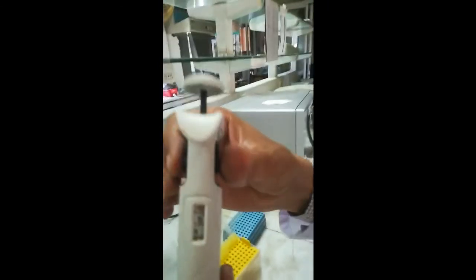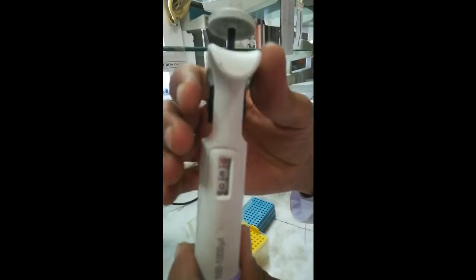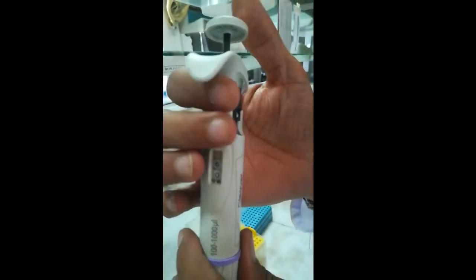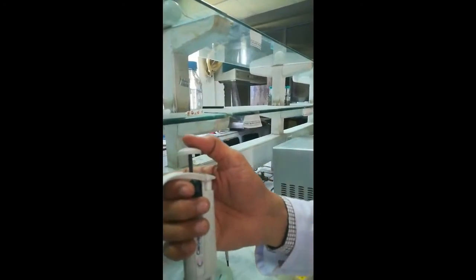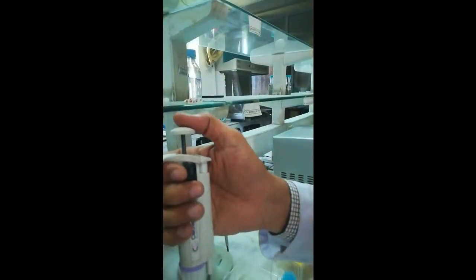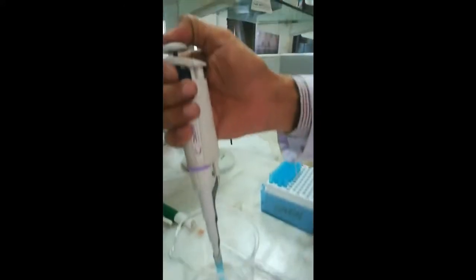Right now we have adjusted the volume to 600 microliter. This pipette has a function for both sucking and pouring liquid. To suck, we push the plunger button down until it moves easily, then dip the tip and release to draw up the liquid.